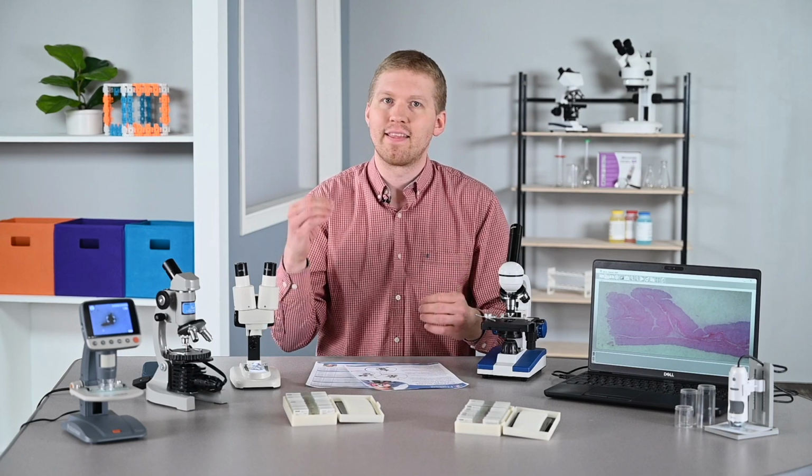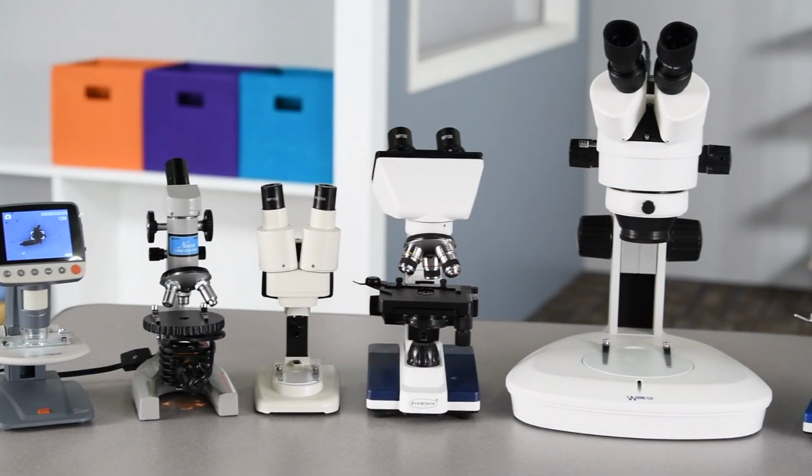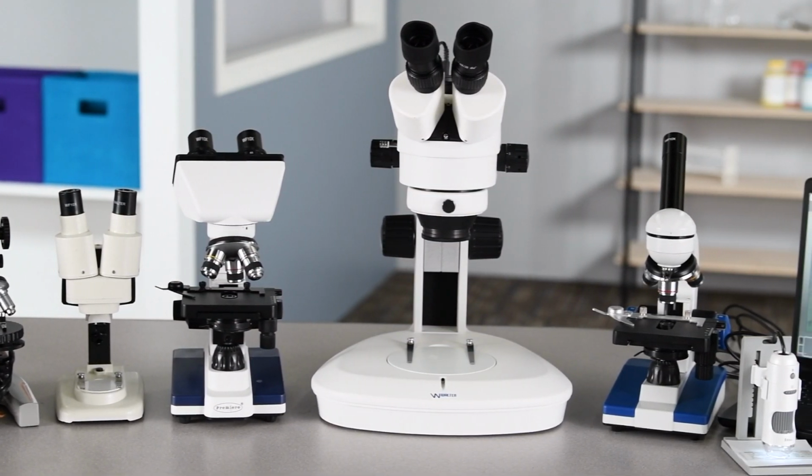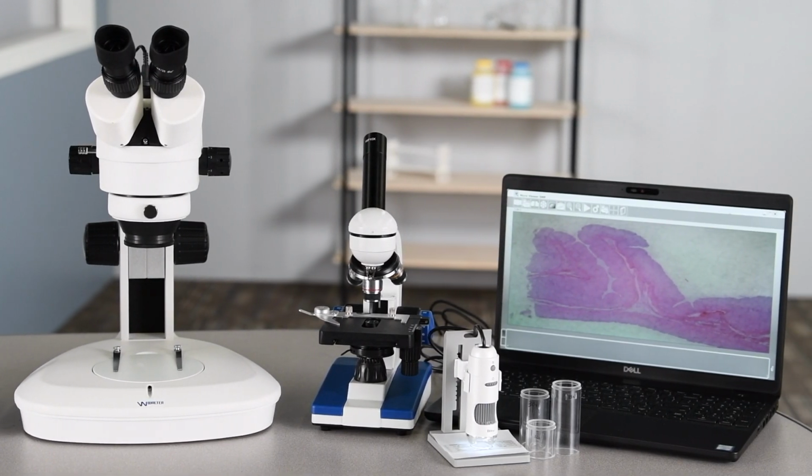What is not always seen on a microscope is the quality of the lens, the construction of the gears, and whether it's metal or plastic, and the type of condenser being used. Most often microscopes will have a 10x lens, 1.25 Abbe condenser, and then the better quality ones will have metal gears. But that's not all.